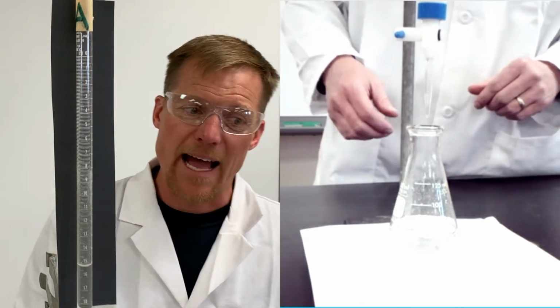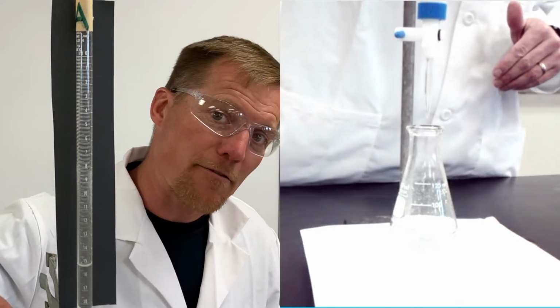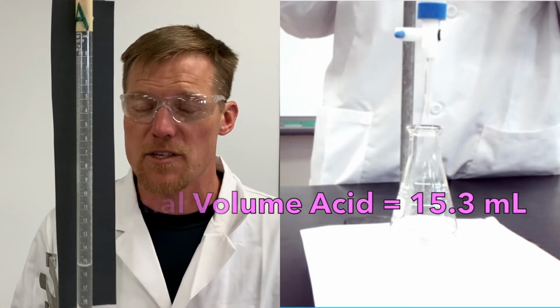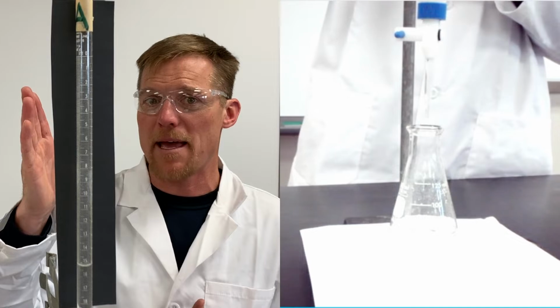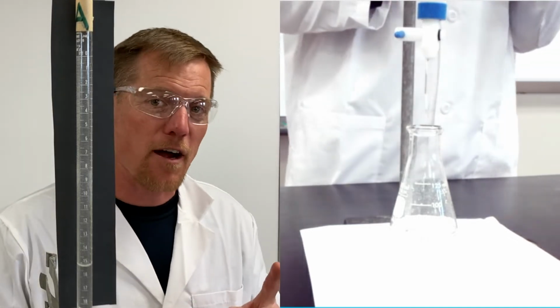So, looks like I have my initial volume at 0.3. I've got my final volume at 15.3, which means I put in 15 milliliters of my 0.5 molar acid. I know my MA and my VA. It's time to figure out what the molarity of our base is.